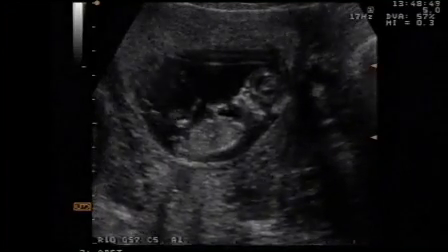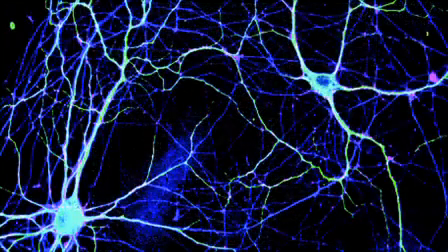This includes intact spinal cord, cortex and dissociated neuronal culture preparations.